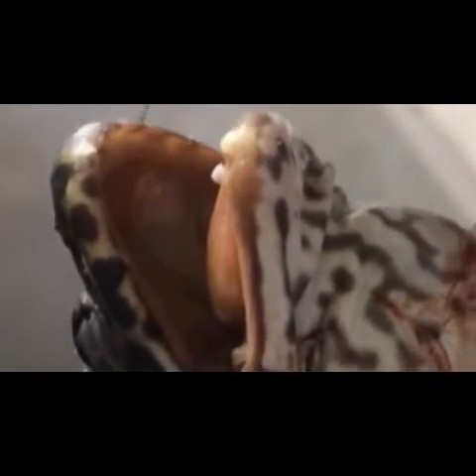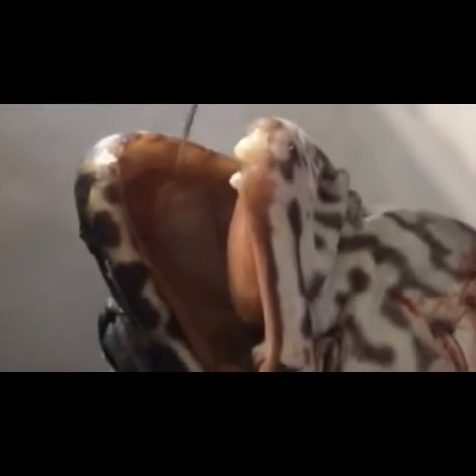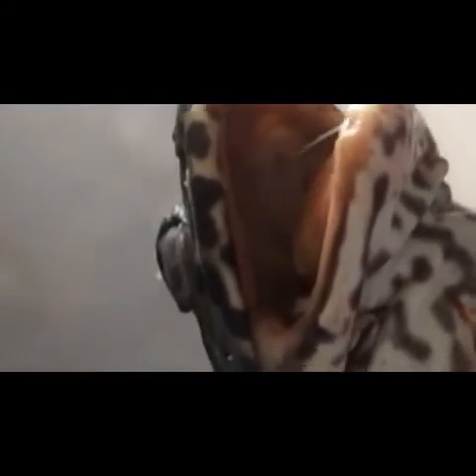And then beside them is the vomerine teeth here. And then the upper lip fold. And then maxillary teeth here. And then orbital prominence — the two bones here.